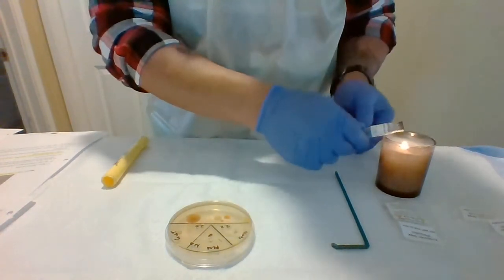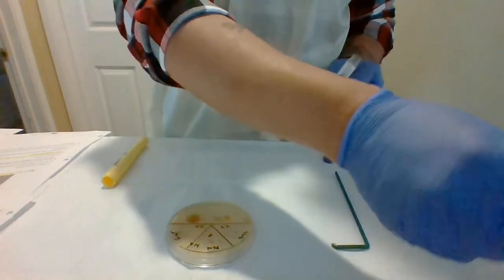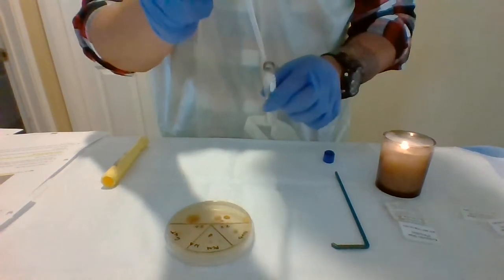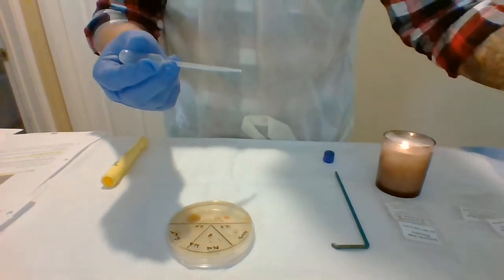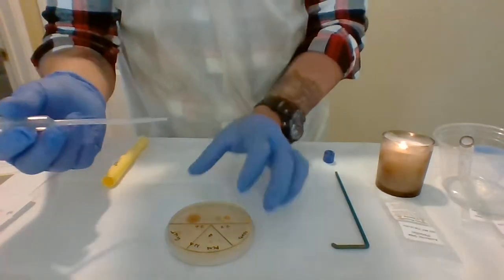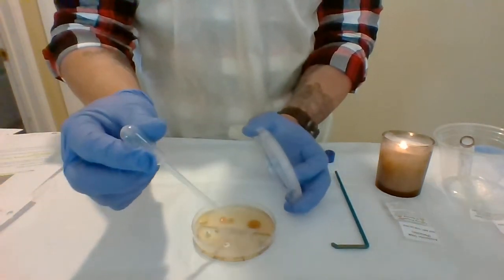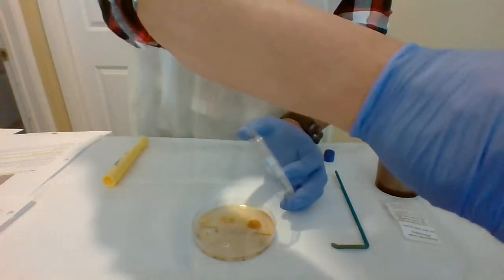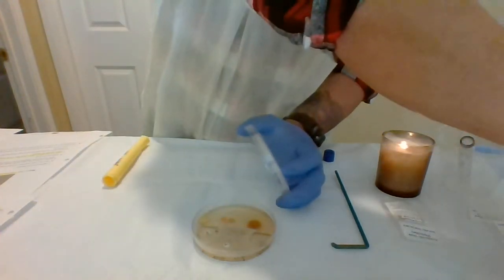I'm going to heat it. The vial. I've got my pipette out of the alcohol, and I'm going to take 0.5 ml of this. 0.5 ml. And I'm going to drop 8 drops. Turn this over. 8 drops into the center of the dish. Put this back in the alcohol. I'm actually going to go with bleach here. So I'll be done with that.